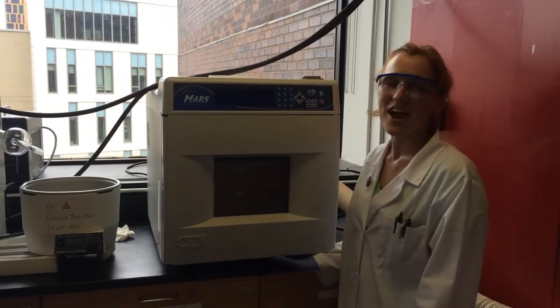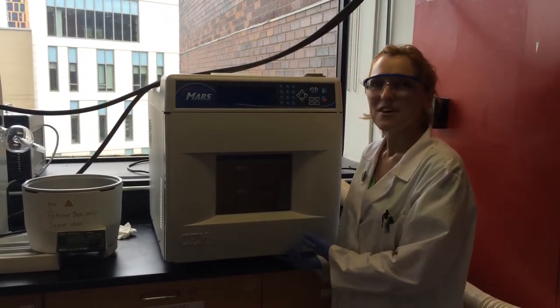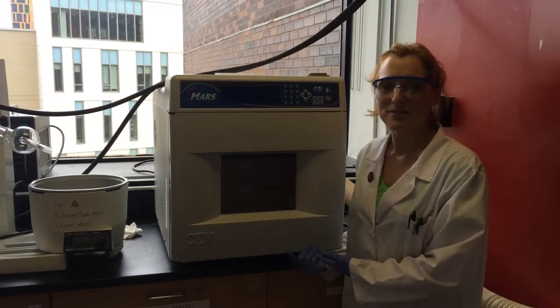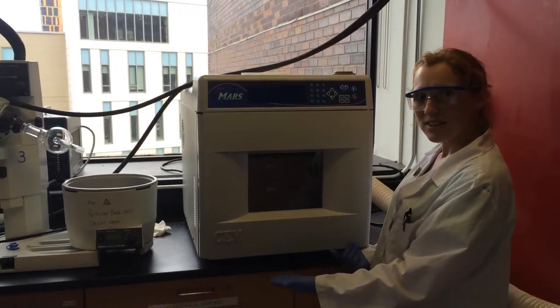Hi everyone! Today we're going to teach you how to use the microwave for synthesis. First, we're going to start by teaching you the parts of the microwave. This here is our microwave.